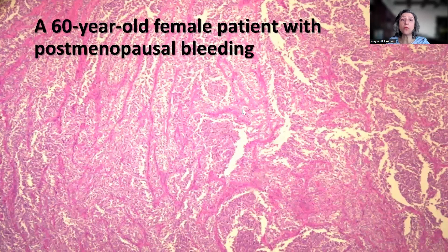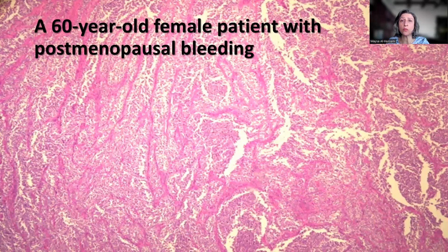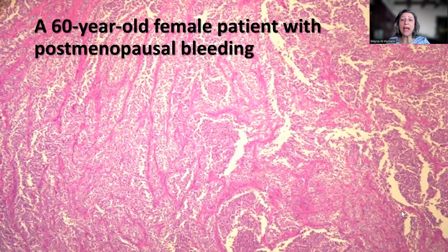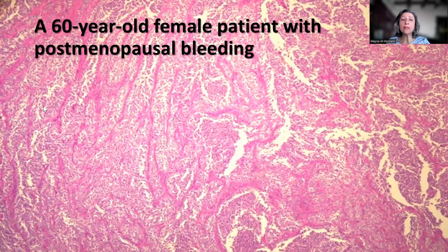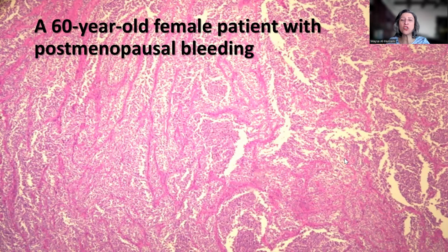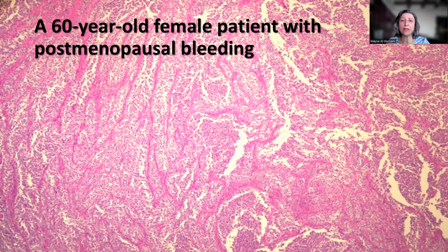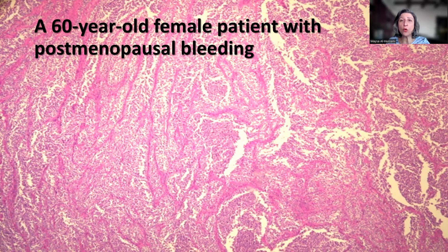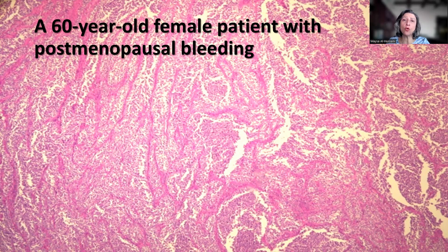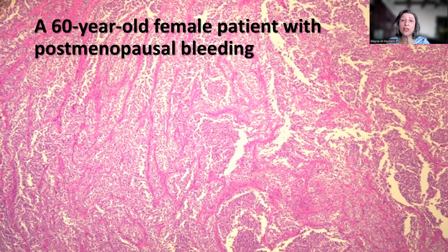This is a case of a 60-year-old female patient who presented with postmenopausal bleeding. And as you can see from the low-power magnification, there is a sheet-like growth pattern with no tendency toward glandular formation or papillary formation.